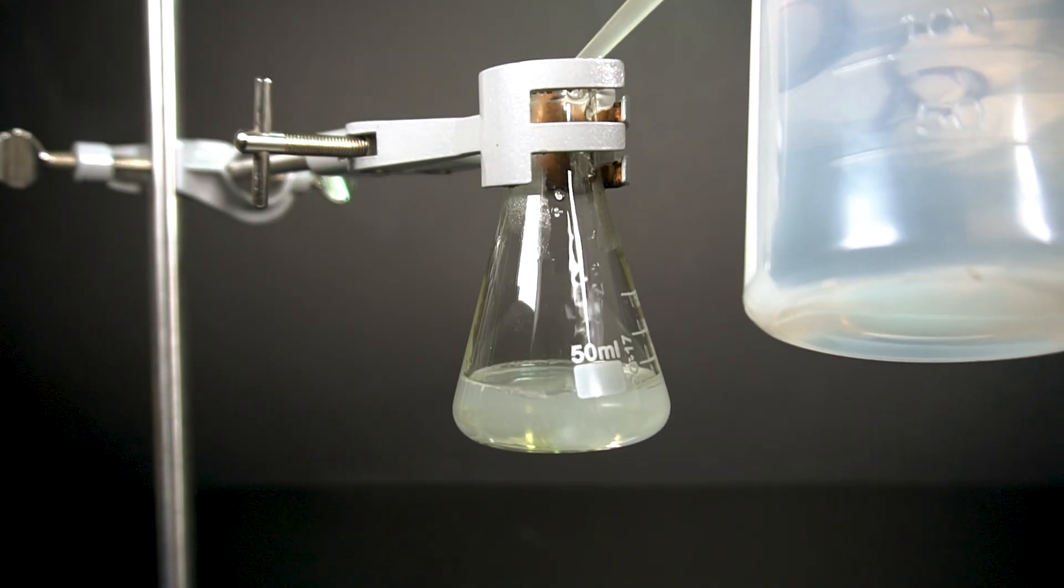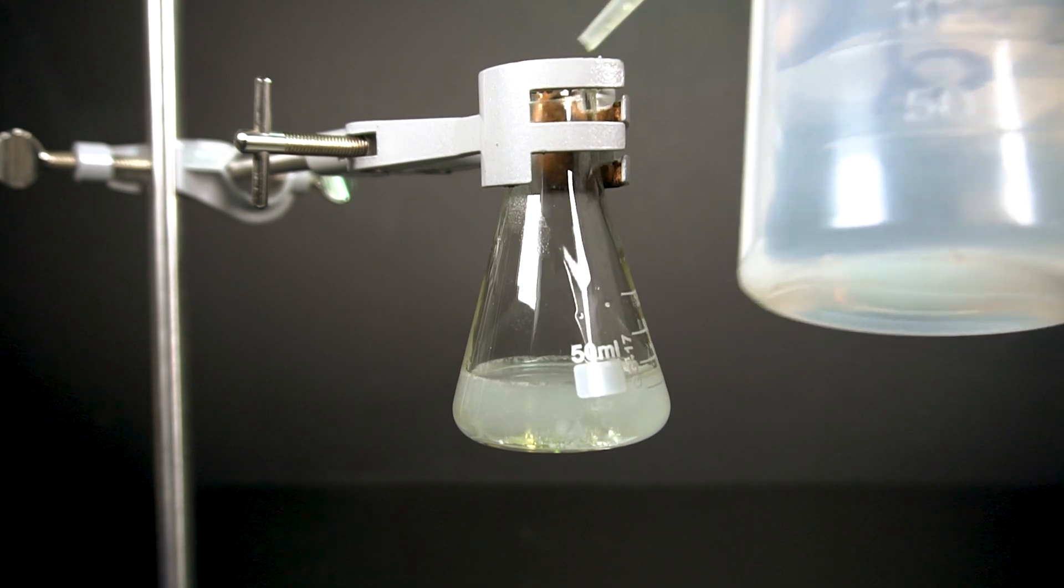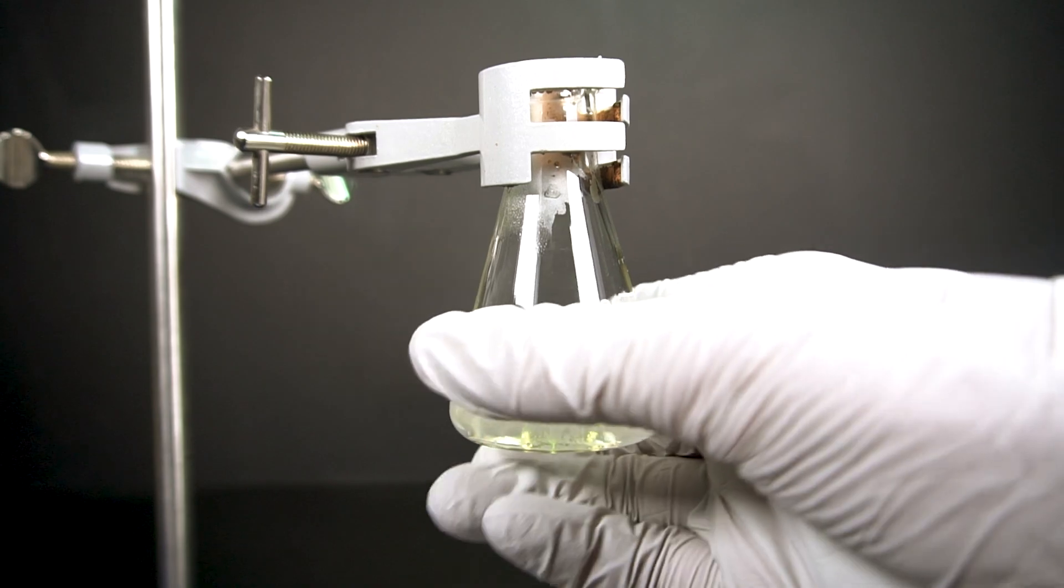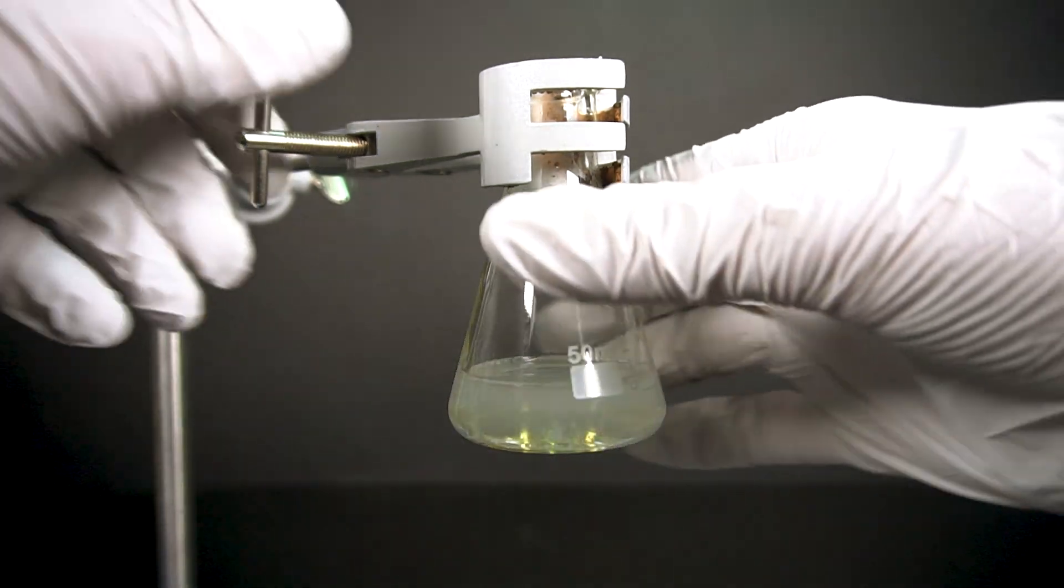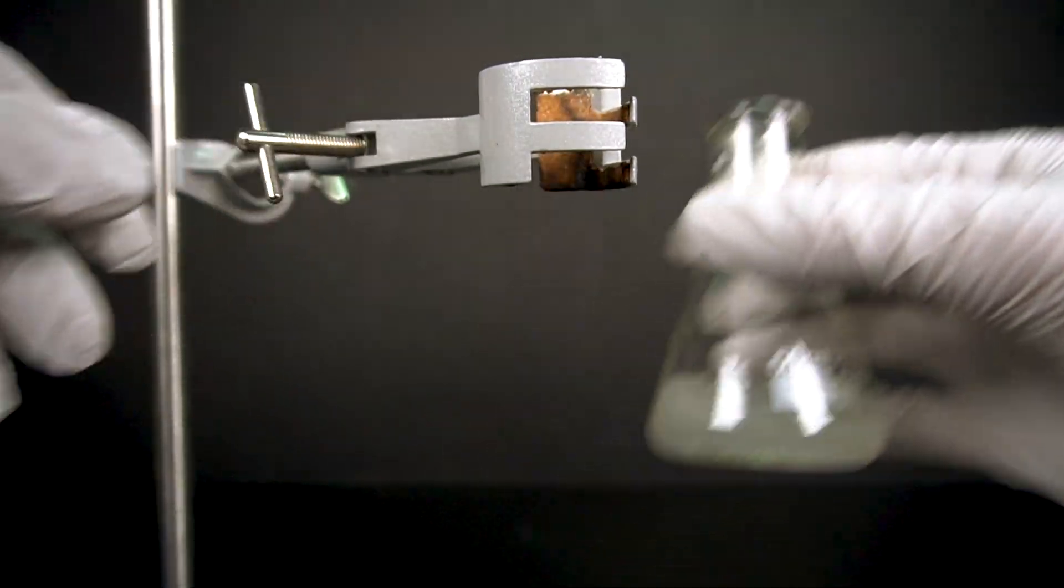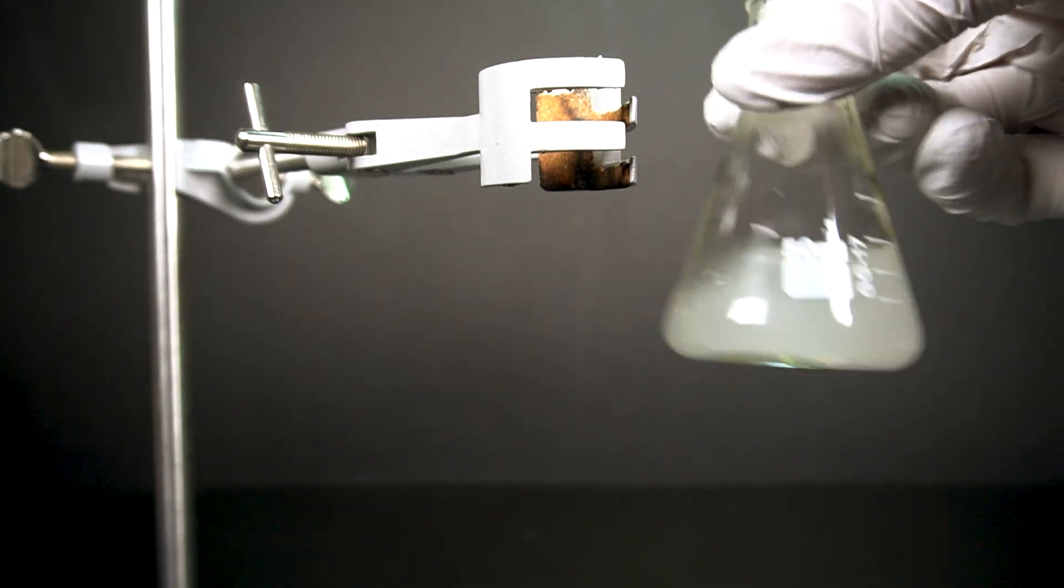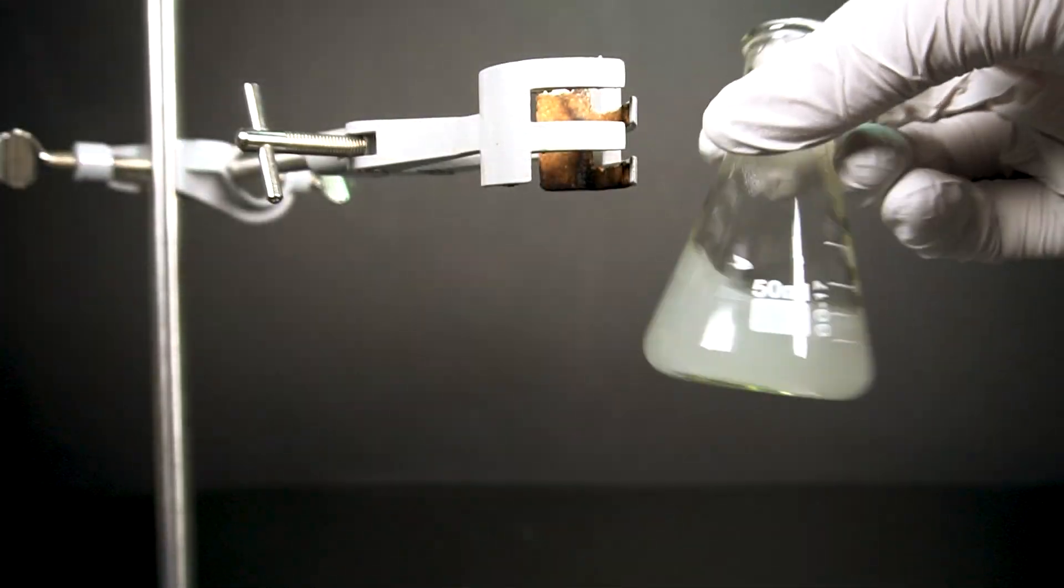This addition must be done cautiously, and the reaction between the sodium hydroxide and the water is extremely exothermic and creates a lot of heat. When I was done adding the 15 grams, my solution was just around 65°C or 148 degrees. Getting everything to dissolve took a few minutes of stirring.